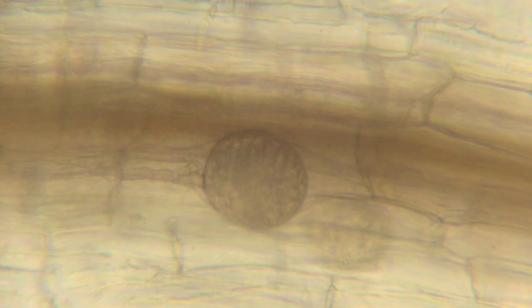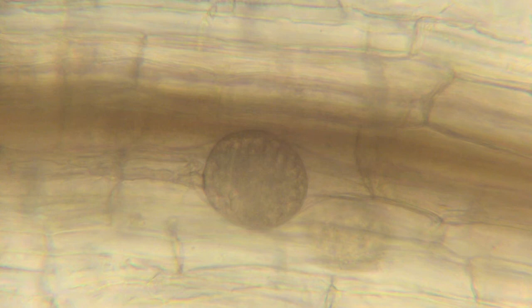As mentioned, it looks like there are some other fungi involved. Scanning around some of the other roots, we ran into Polymyxa — the resting spores of a Polymyxa. It's a chytridiomycete obligate parasite of plants. It normally doesn't cause serious problems, but it's possible that interacting with the summer patch, we're getting a different symptom. In addition, we ran into some mycorrhizal fungi attacking the roots — normally beneficial, but in cases where plants are stressed, maybe all of them together resulted in a different symptom.